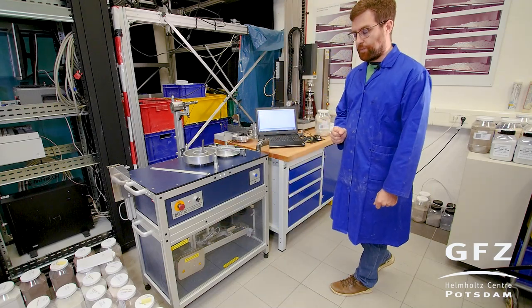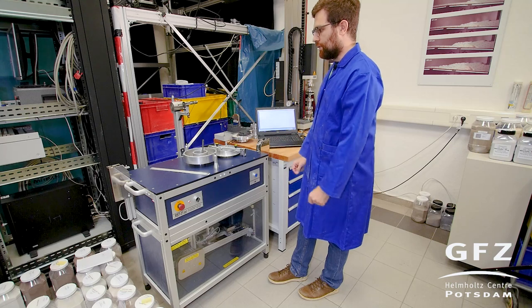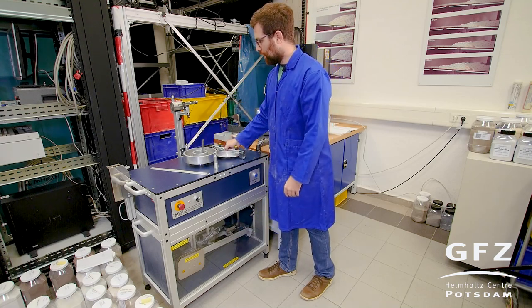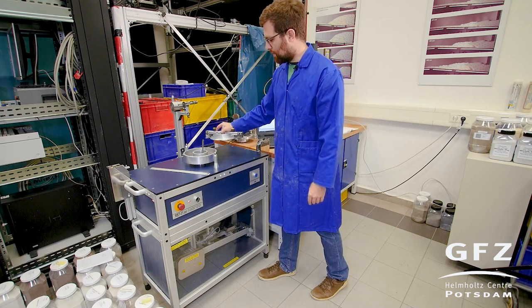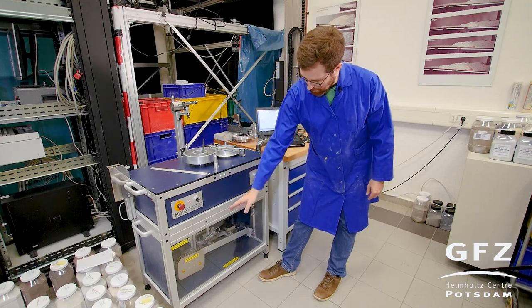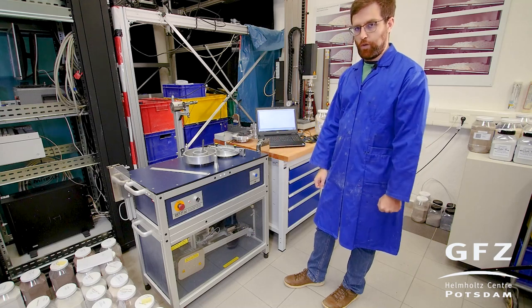The machine itself has several sensors. It has two shear sensors which are normal force transducers coupled in series. Then we have a counterweight which serves to counter the lid weight, and attached to it a sensor that measures the lid displacement so we exactly know where the lid is positioned. It also has a normal load sensor attached to this weight which can be moved along the bar to increase the pull on the pulley, and this then applies the normal stress on the sample.